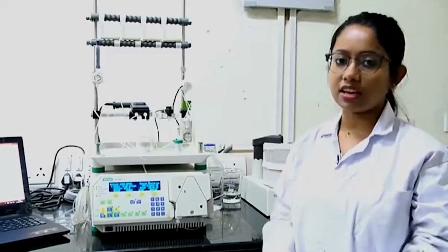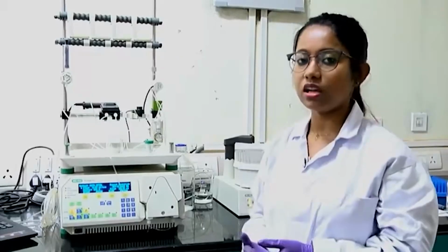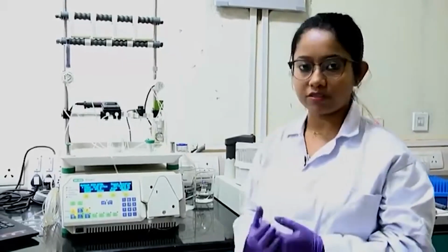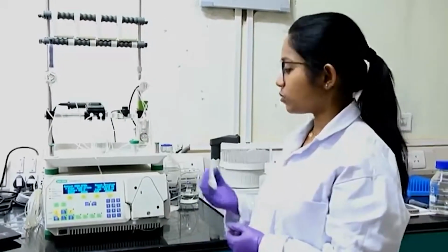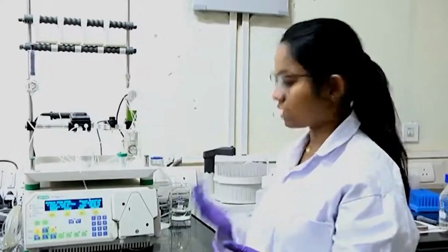Basically at the end of this purification procedure, you will have a particular recombinant protein which has a 6-histidine tag on its own, and you have to confirm that after running a gel, and this protein will be readily used for further experiments. All these fractions are 2.5 ml. I will collect almost 10 fractions, so almost 25 ml of sample I will get.